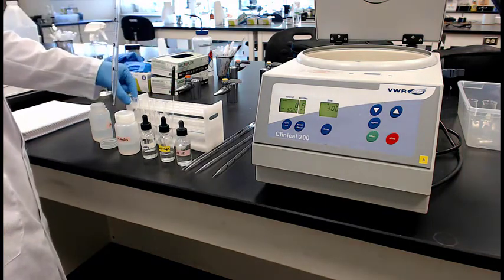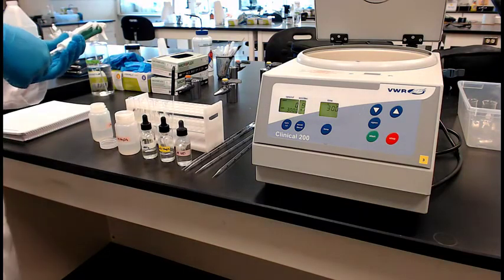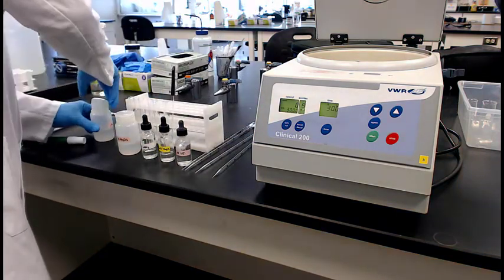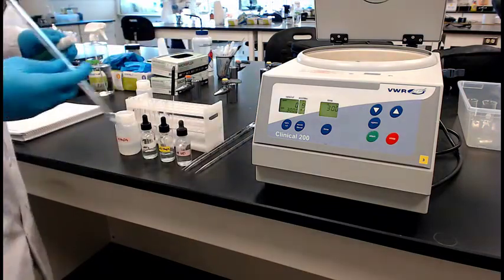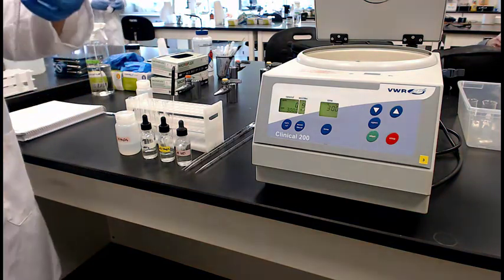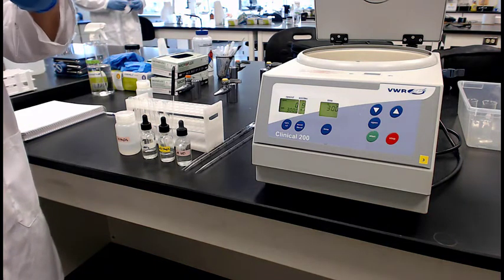Got it. We're going to keep that pipette hopefully separate from the other one. Yeah, thank you. Now the other thing is he just pulled that out. Sometimes I push it off with my thumb. That's a little better technique. You can just get your thumb next to the shank on that micro pipetter, which is what those green things are called, and you can push it off with your thumbnail.